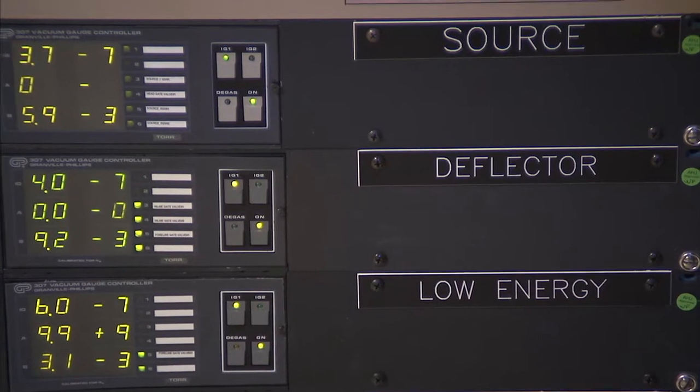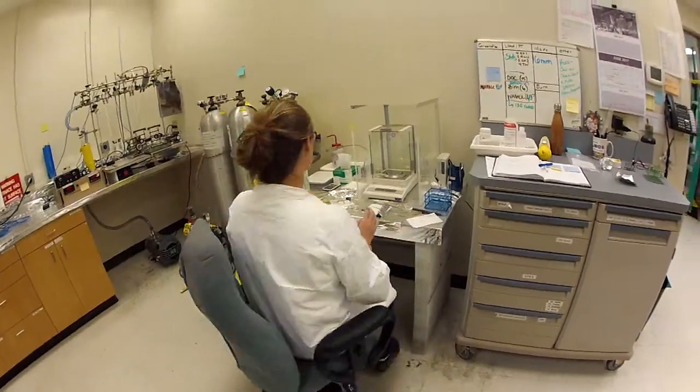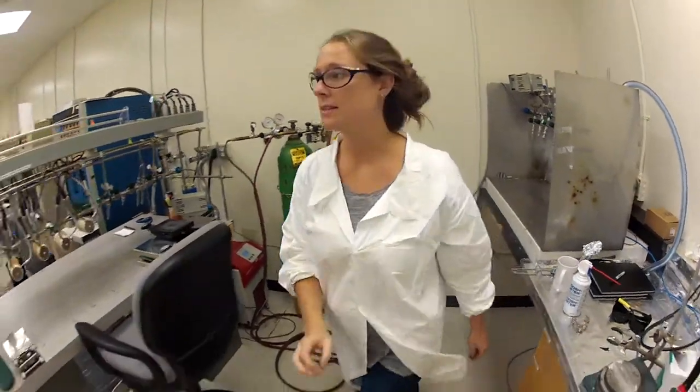It's used amongst other things for radiocarbon dating of archaeological samples and other types of materials. You have a material that is made up of all different types of atoms, but what we want to measure is the carbon. We take a sample that we've prepared and put it into what's called an ion source. It goes through a pre-treatment process, gets loaded into a quartz tube and combusted to form CO2, and then that CO2 gets reduced to graphite, which is what we run on the accelerator.